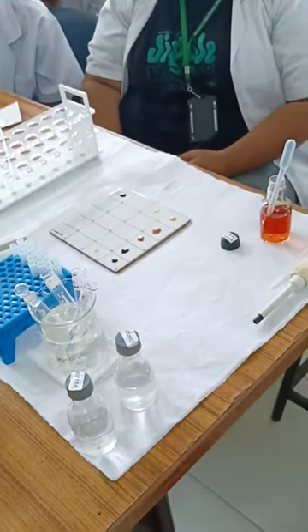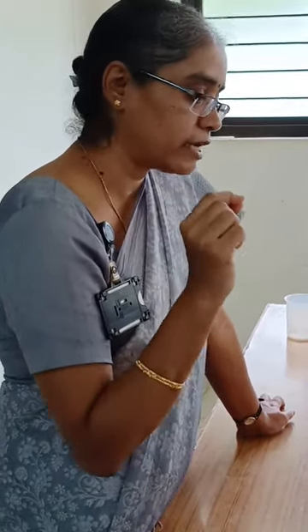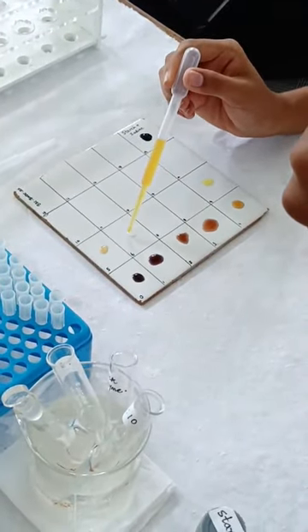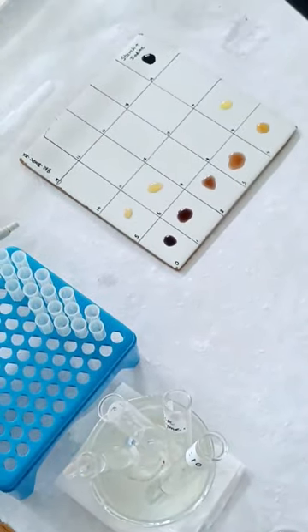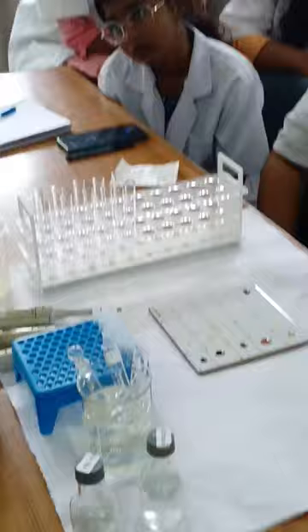In the 6th minute, we will see what is happening. If the 6th-minute color from the reaction mixture matches the iodine color, that becomes the achromic point of the fungal diastase. We add the next drop for the 6th minute and we can see that it is nearing the end, but there is still a slight reddish color in the center of the drop. So we continue the reaction to see the drop color match the iodine color.